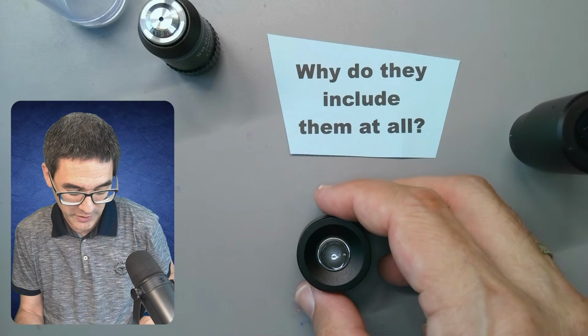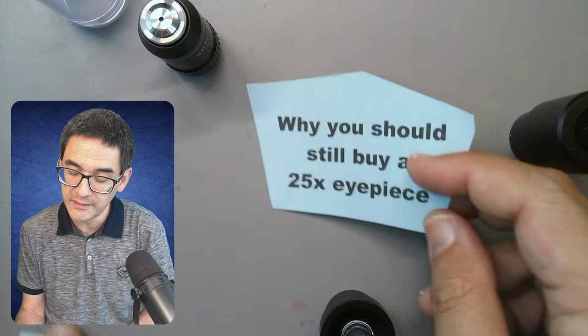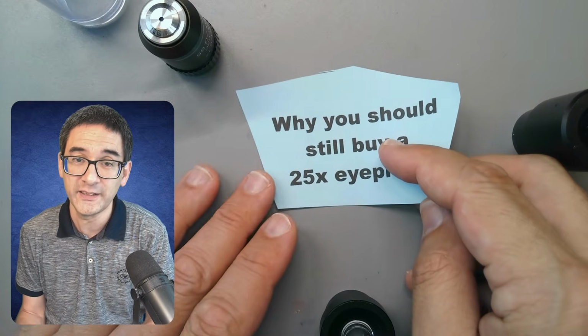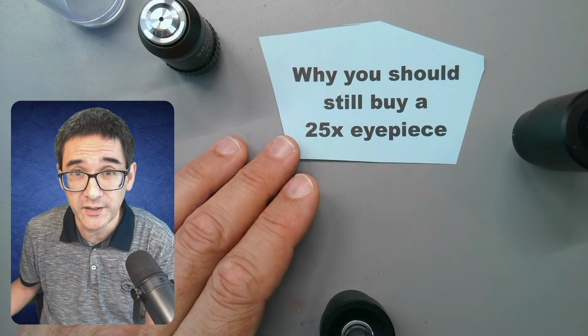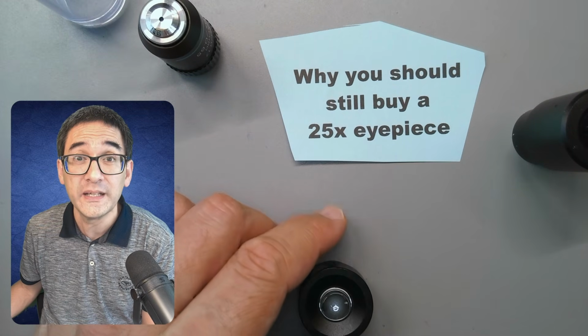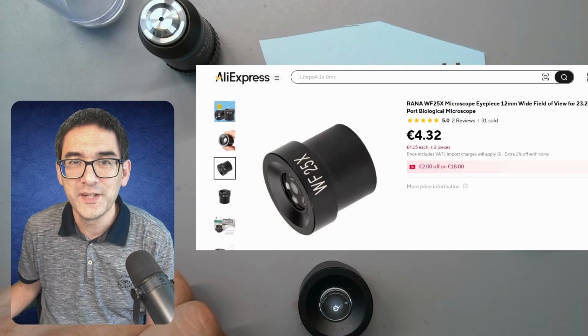And the question is now, why should you still buy one? I've tried to make the case that the advantages are not really there, and I still think that you should buy one. I'm going to show you the reason why I think it's a good idea to buy one in any case, regardless of all of the advantages and disadvantages. And the reason is this.